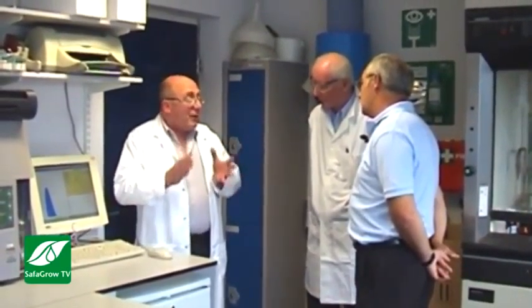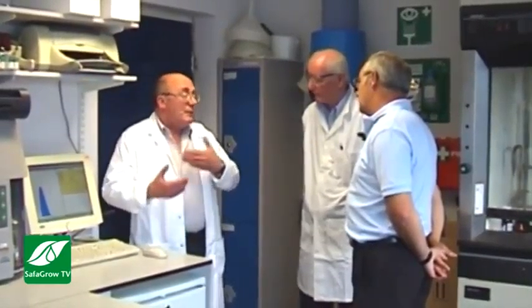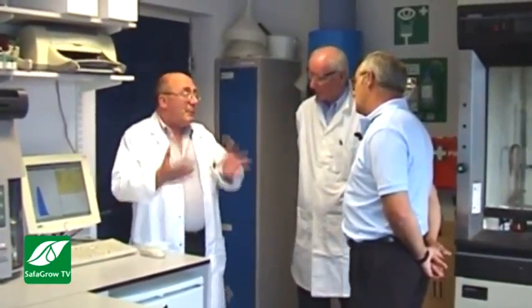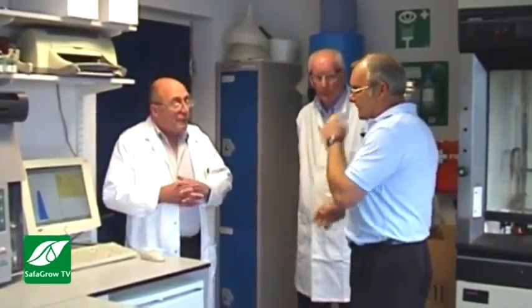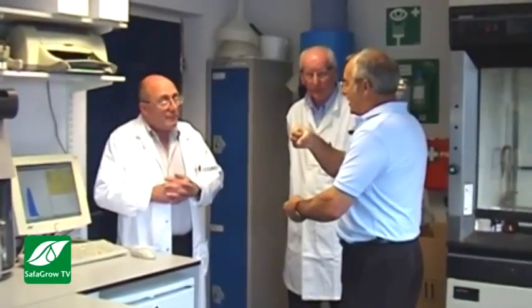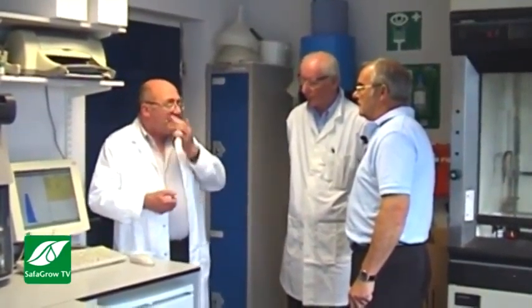You want them to get thick and stay thick at rest, but then when the farmer comes to use them, he shakes them and they become thin so he can tip them out of the can. So that's the benefit. Viscosity means it all comes out the can, 3 rinses, job done. It goes into the tank. When it's in the can, the particles don't go down or precipitate as fast through gravity as they would normally.